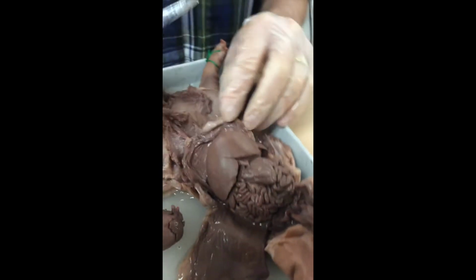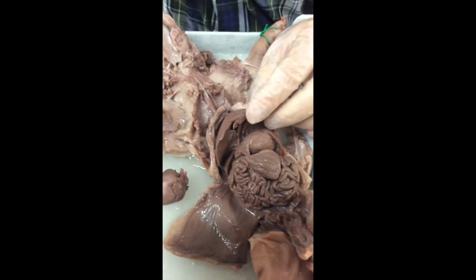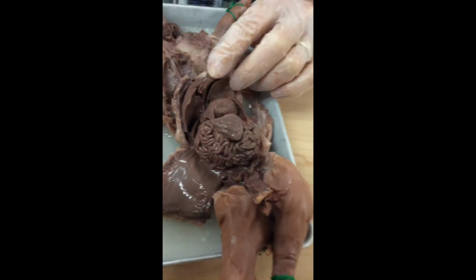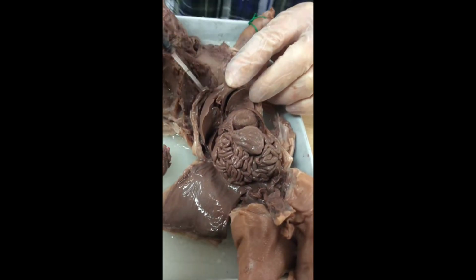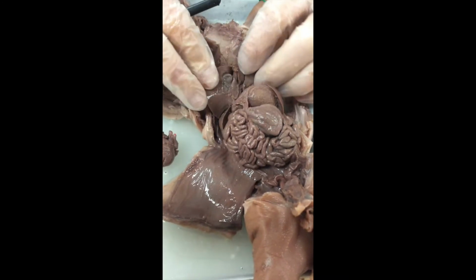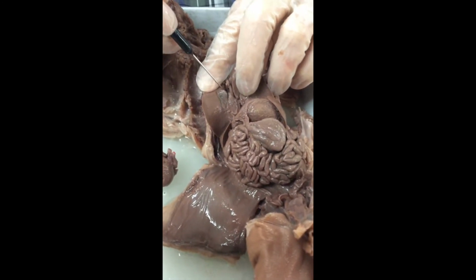We're going to look at digestive organs. The liver is especially a digestive organ. It makes bile, but it also is involved with removing toxic materials from our body. Some of you remember from 8th grade health that the liver metabolizes alcohol. I flip that liver open on the back side. I don't have to cut anything. I just flip it open here a little bit.